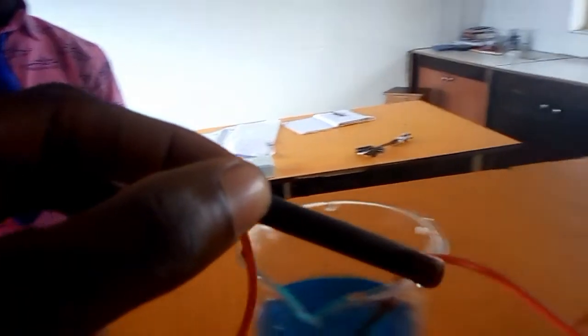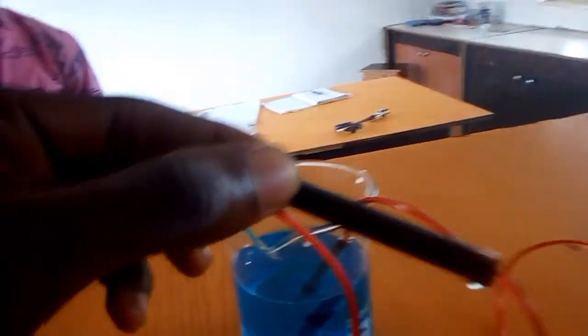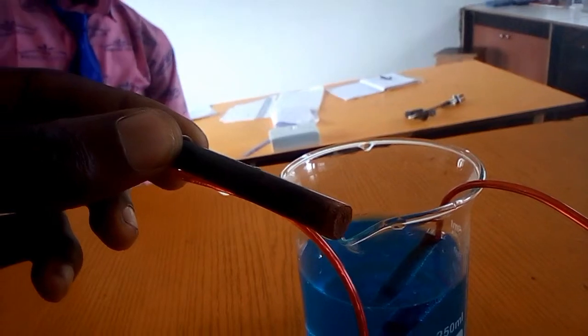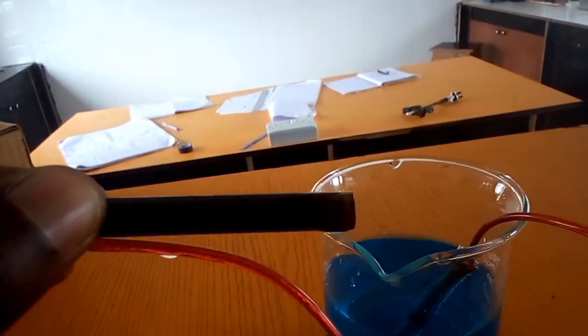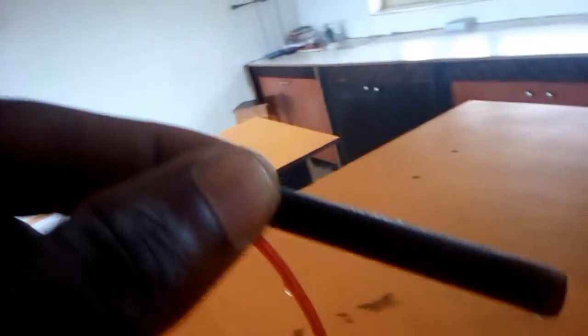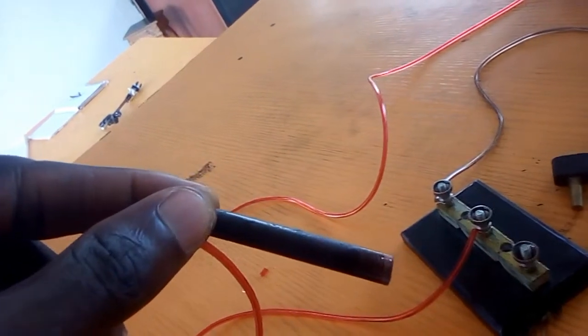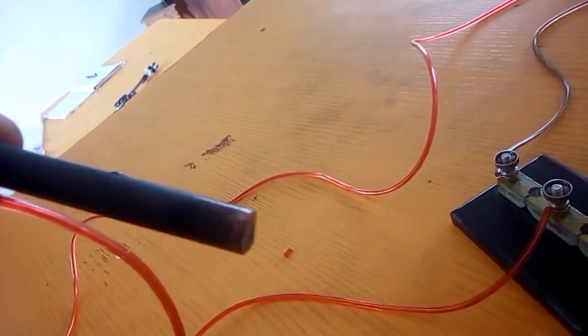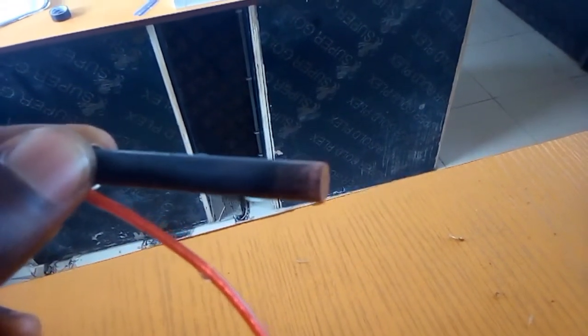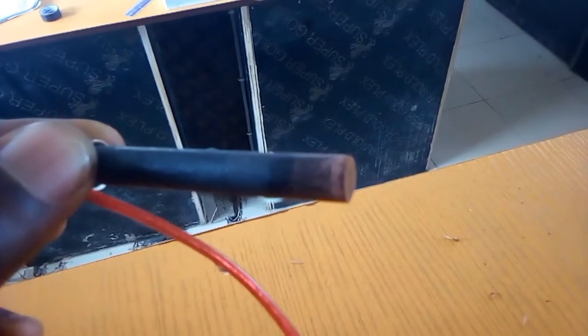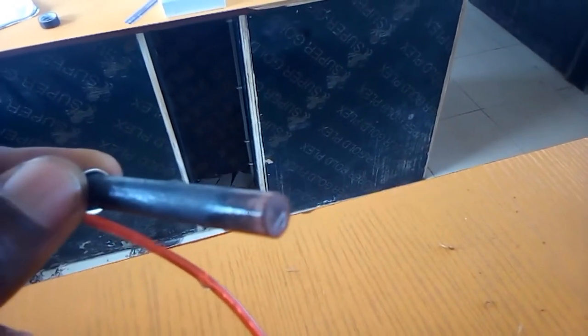Let's observe the change in color. Can you see this? I don't know if you see that. The tips are getting a little bit lighter or a kind of brownish color. As you can see, let's observe in more light. Can you see this? Yeah, that is how it looks like. So we see a deposit of copper on it.